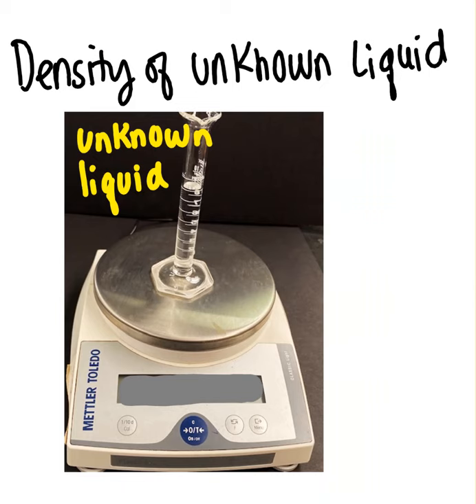Next, we're going to look at our unknown liquid. And this may look like water. It's clear or colorless, but it is not. It's another kind of liquid, and different people will get a different one. So the first thing we're going to do is to put a lot of liquid in there and determine its volume.